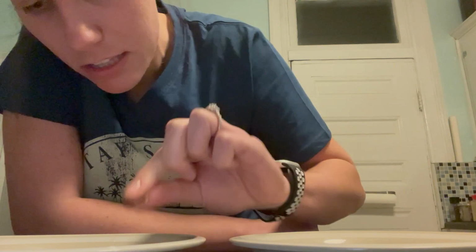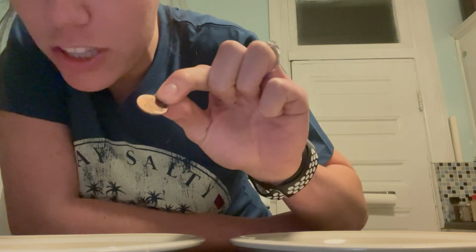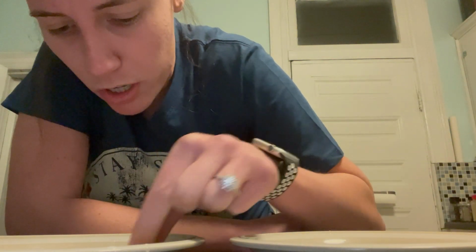Honestly, I must say that this one did not work very well. However, I do believe it is because it was not actually copper oxide on the penny. I do think there was a little bit of dirt on the penny, which you could potentially just get off by scrubbing it. And then this one worked pretty well. But the same thing I would say is those pennies might have just been dirty because of other factors such as dirt or other things other than copper oxide.